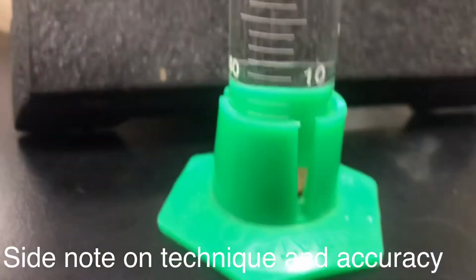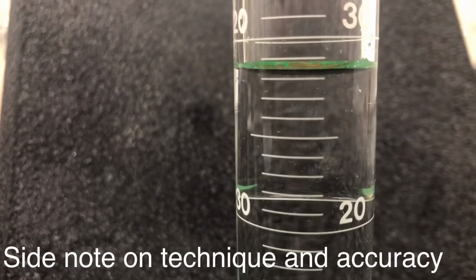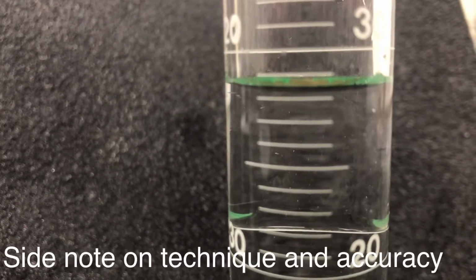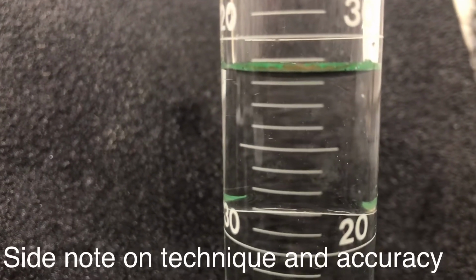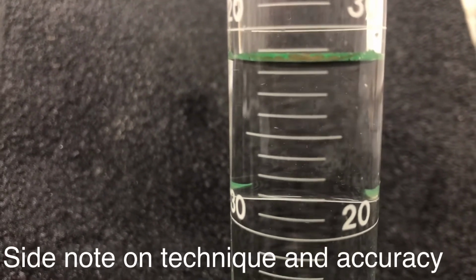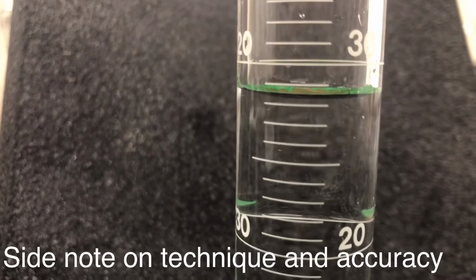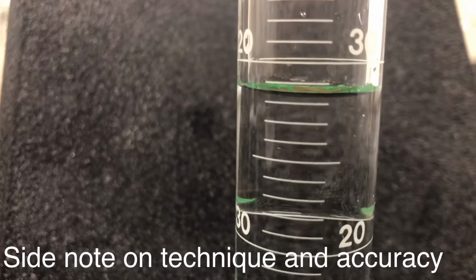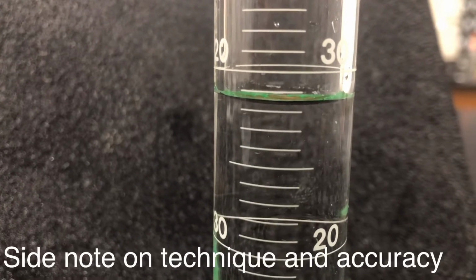So now I put my 1 penny in there, making sure we didn't have any air bubbles. But now I've gone up to 28 point something, right there. If we divided the mass by this, how much error could we incur if we only have a small amount of mass and we know that our significant digit only goes out to 0.1? Well, if I've only got just a tiny bit of change in my volume, then my percent error could be really high. So what would that do to our precision or our accuracy?